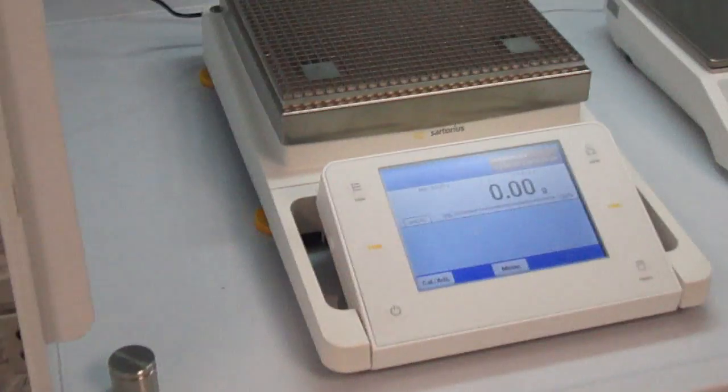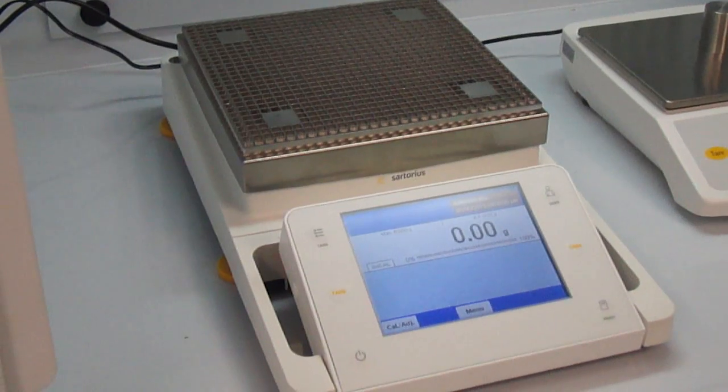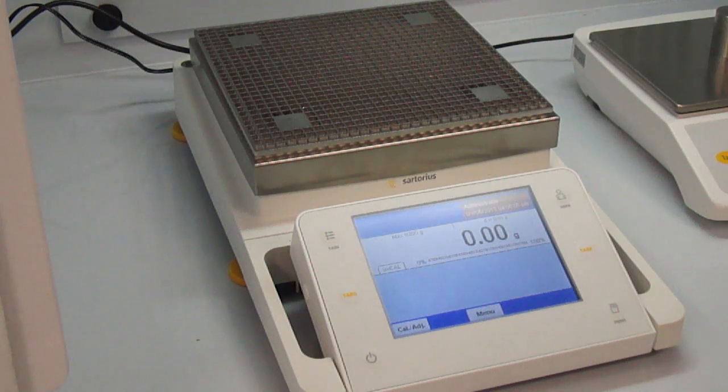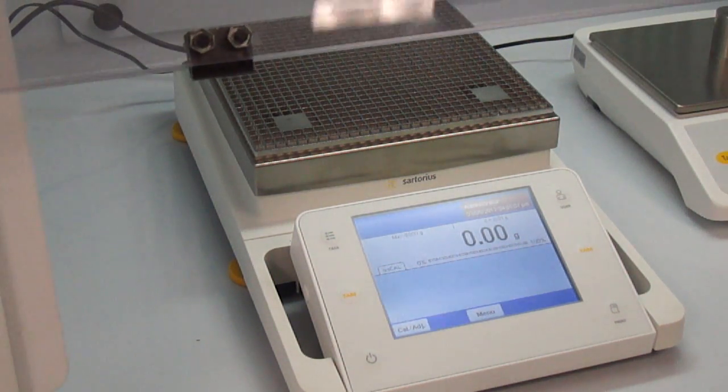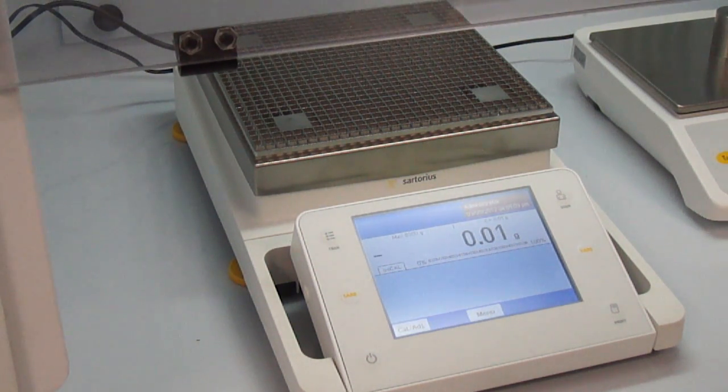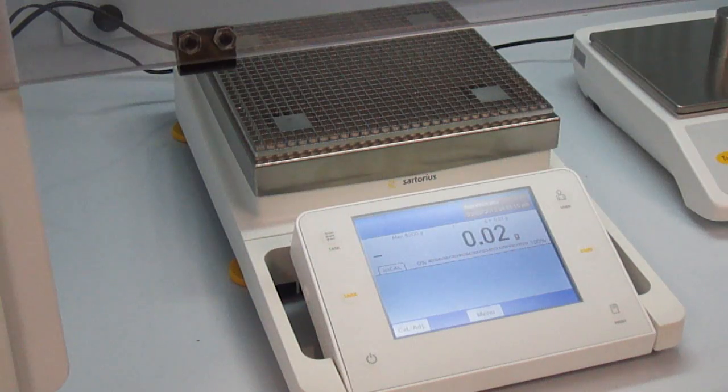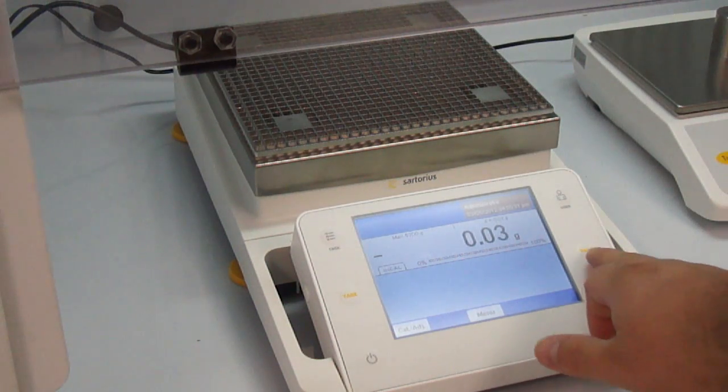You can see right from the beginning. Fairly stable. That's with the glass open. I'm going to close the first layer. I think that little fluctuation was from me touching the hood. So I'm going to tare it out.